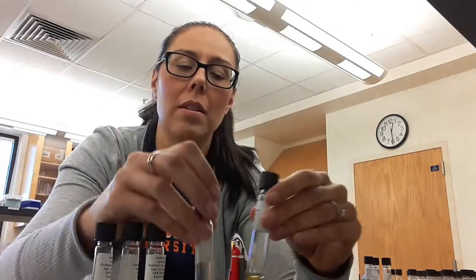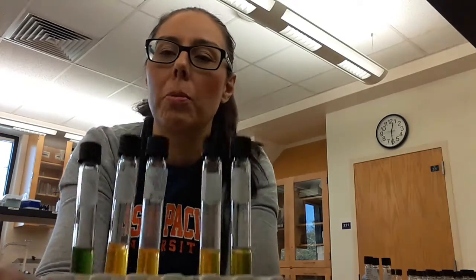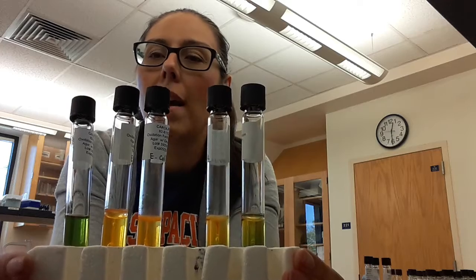Okay, so what does this tell us? On your chart down on the bottom, it has O/F, and it will have two choices, either OA, which means it's an obligate aerobe, or FA, which means it's a facultative anaerobe. So your cultures will be able to tell you whether you have a facultative anaerobe or an obligate aerobe.